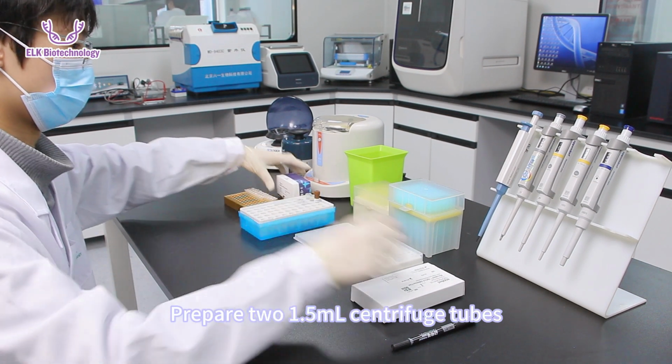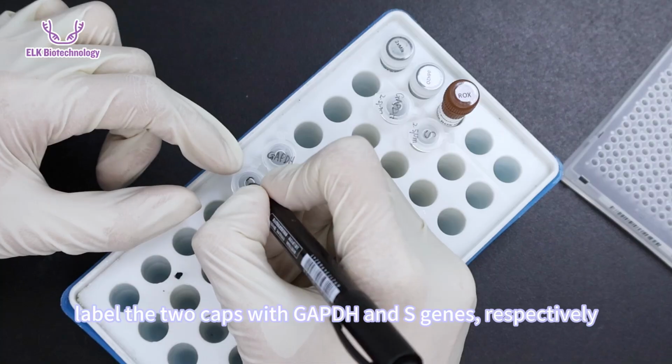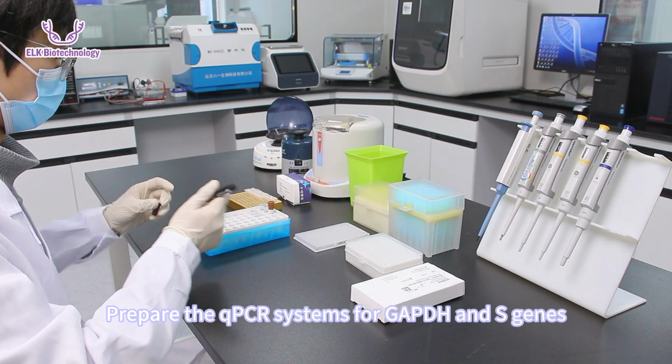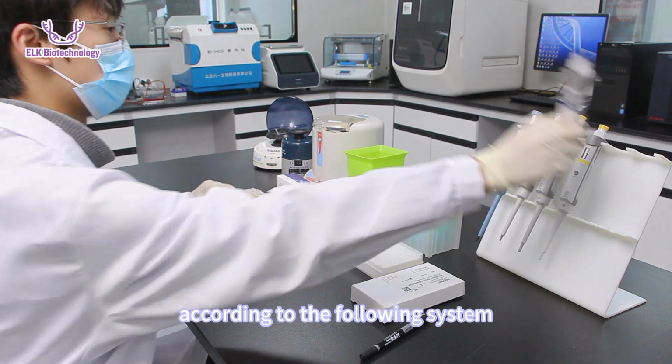Prepare 2 1.5 milliliter centrifuge tubes, label the tube caps with GAPDH and S genes, respectively. Prepare the qPCR systems for GAPDH and S genes according to the following system.